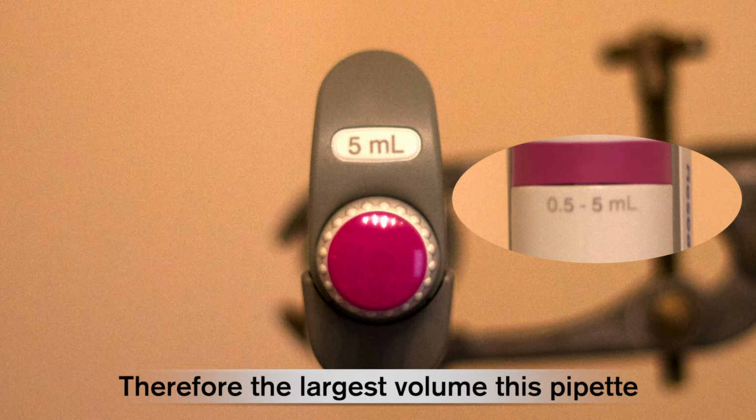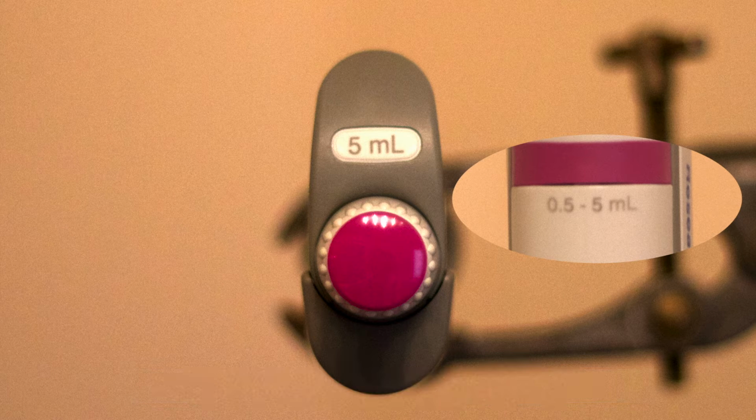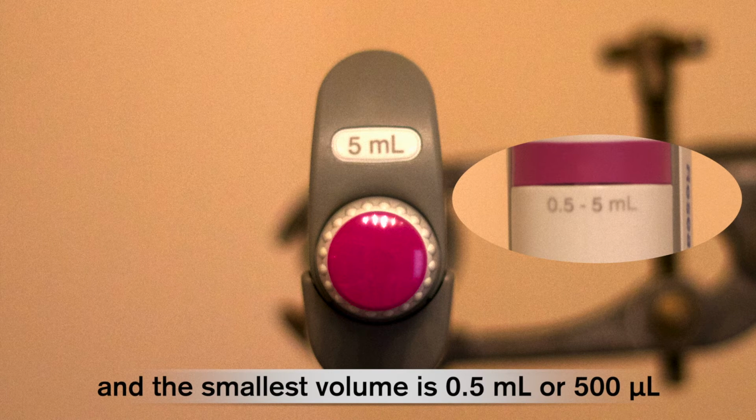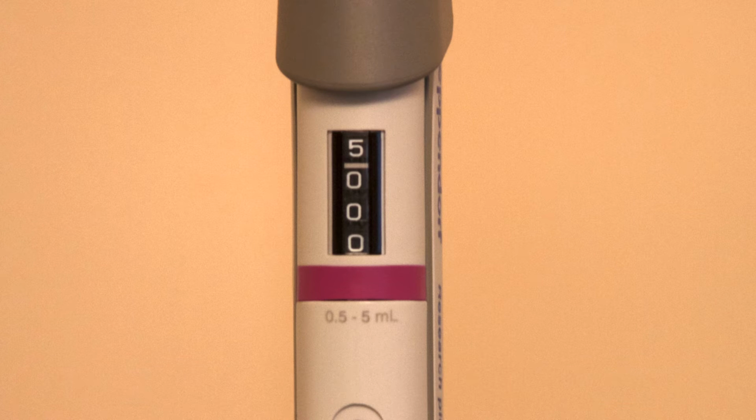Therefore, the largest volume this pipette can dispense is 5 millilitres or 5000 microlitres, and the smallest volume is 0.5 millilitres or 500 microlitres. 5 millilitres is shown on the side window display as 5, 0, 0, 0.